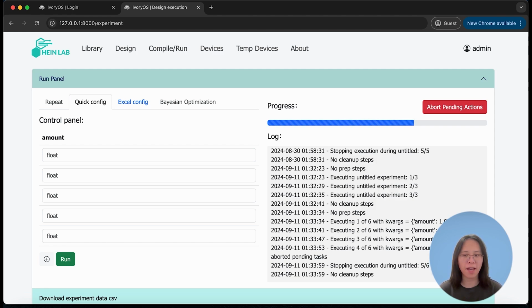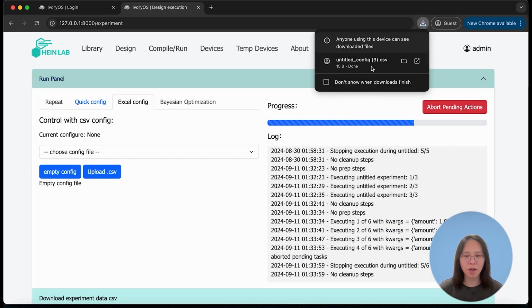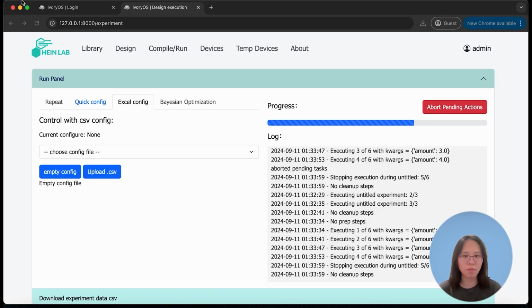In the control panel, we have very limited space to input parameters. So in case you have more than 5 parameters to input, you can also choose to use the Excel configuration, where here you can download an empty configuration file and then open that in Excel. The first row shows all the parameter names, and the second row shows the expected input type. Using column A, you can input as many entries as you want and then upload this Excel file back to the system to iterate the current design.